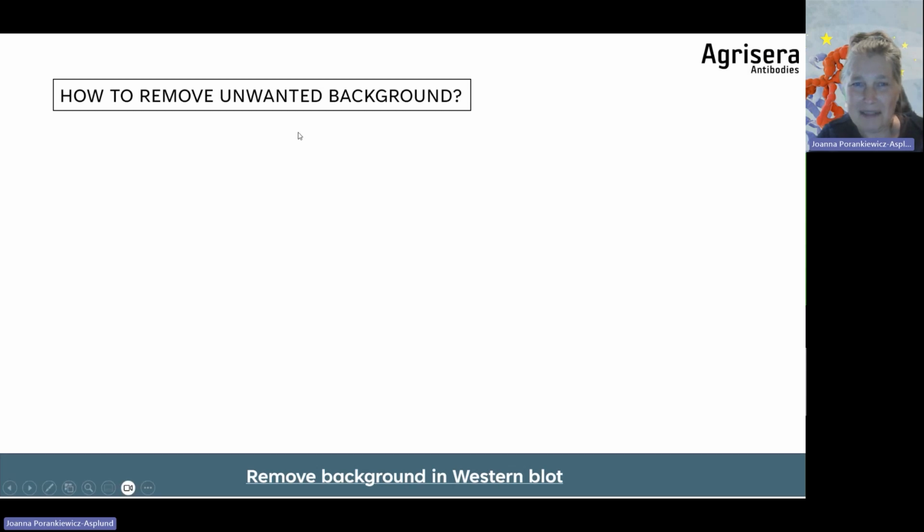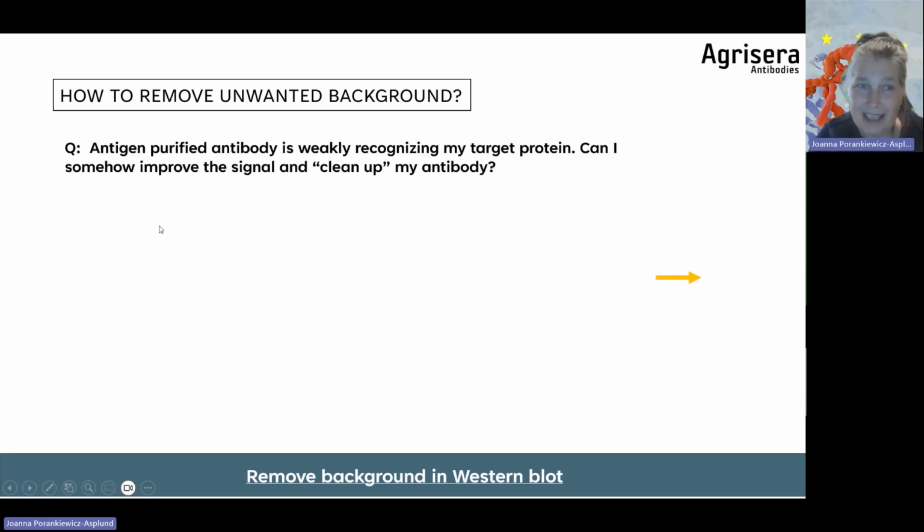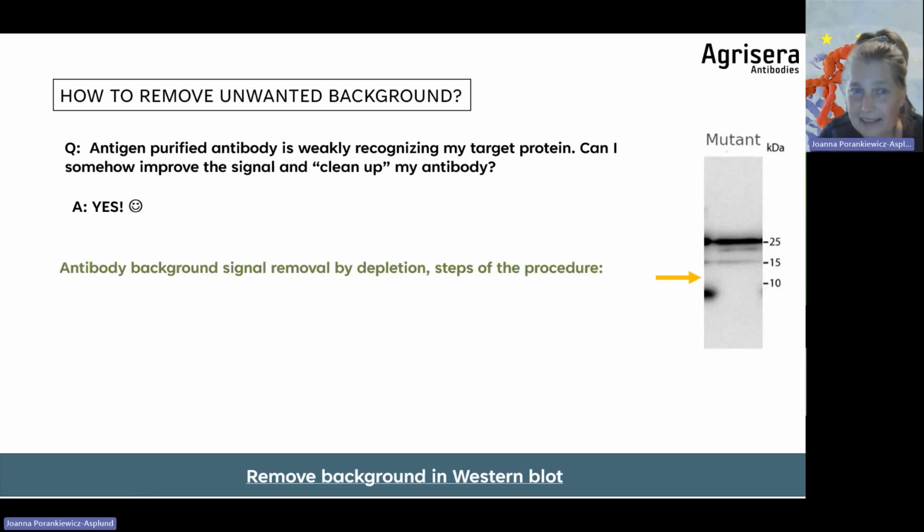And now we are coming to the background issue. This is a question I have received: a customer used a purified antibody, which was very weakly recognizing the target protein. There were other bands coming up, and is it possible to clean up this primary antibody solution? And the answer is yes. This is the so-called depletion, to clean up the primary antibody solution and remove these cross-reacting bands.